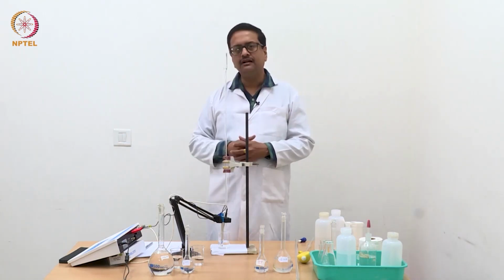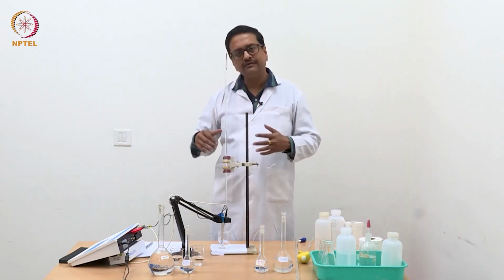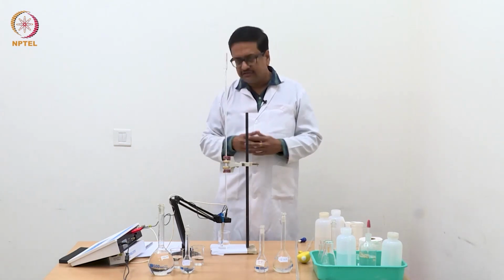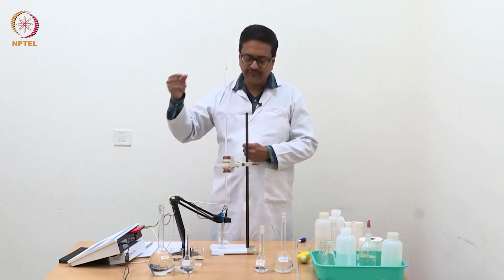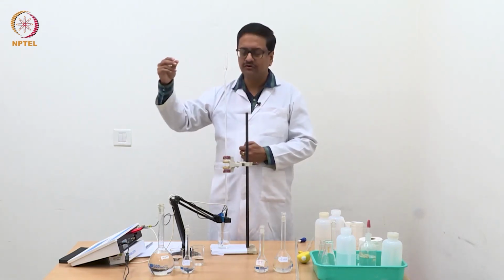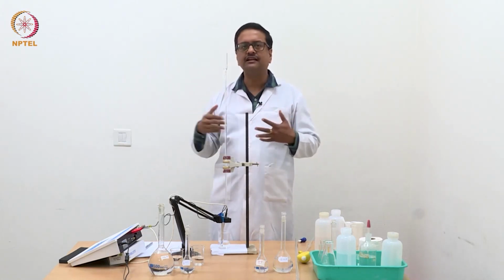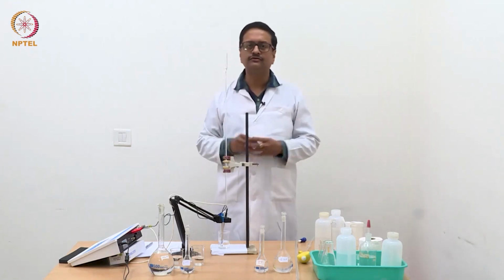So identification of the equivalence point during the titration is important, so that after it is reached, you can increase your step width from 0.04 to 0.1 ml and get 5 or 6 readings after the equivalence point, so that you can draw a straight line through those points.